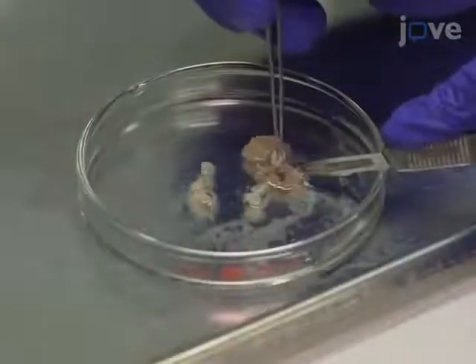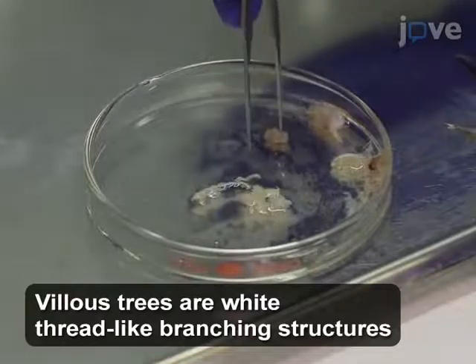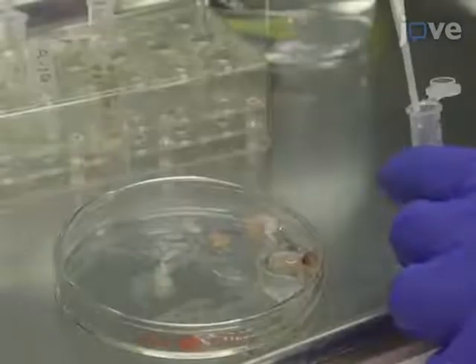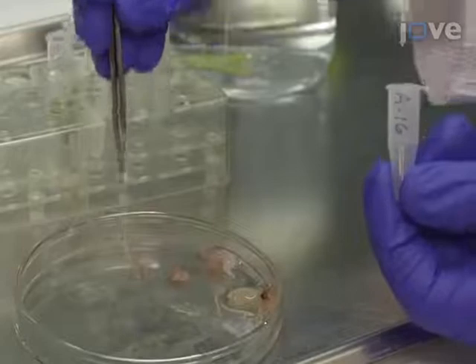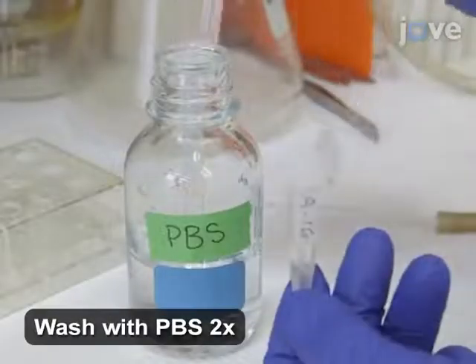Then, dissect pieces of the villus tree approximately 5 millimeters in length and transfer into a microtube containing 1 milliliter of phosphate-buffered saline. Replace the phosphate-buffered saline with a fresh one, and wait for 10 minutes with occasional swirling.